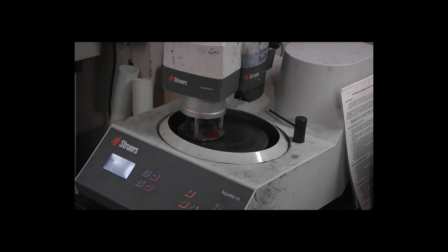All right, one more stage after this. And that's the one that turns it from polished metal into a mirror. Because at that point, the wavelength of red light is about 0.6 microns. Wavelength of blue light is about 0.4 microns. And we've polished the surface to plus or minus 1 micron. So the surface is flat to only a little longer than the wavelength of light.